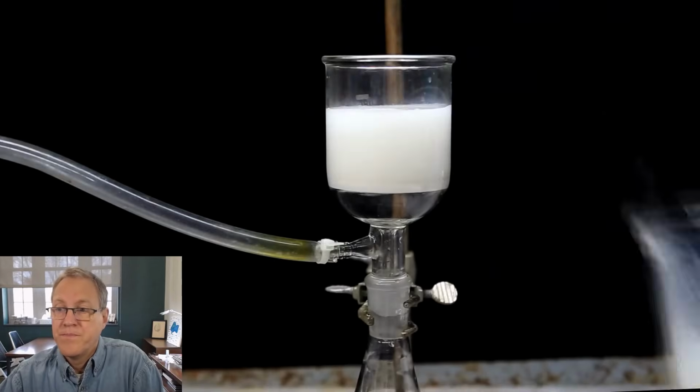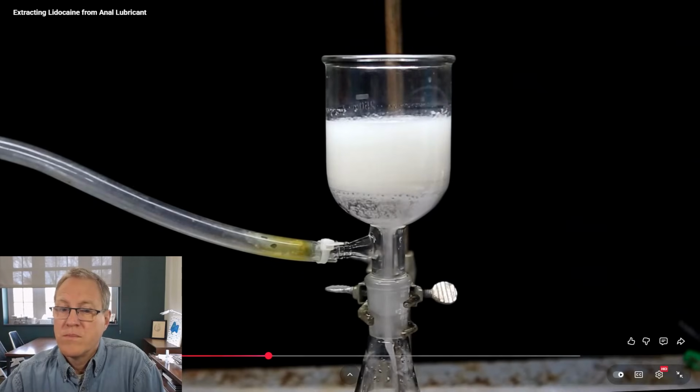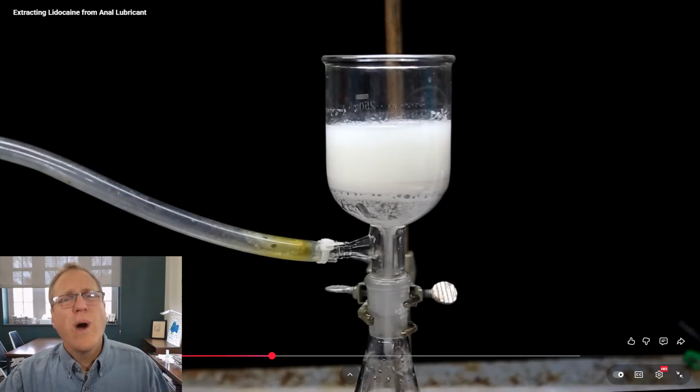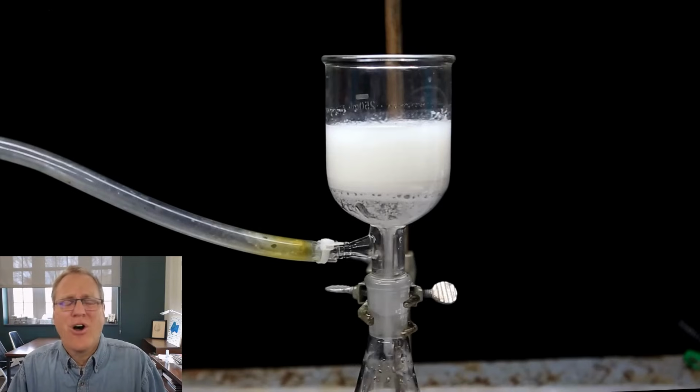And now, the lidocaine can be isolated by vacuum filtration. I would say a vacuum filter is really necessary for this because gravity filtration would just take forever. Why would gravity filtration take forever? Well, remember that this does still have all those thickeners in here. Although it's largely water, there are a lot of these thickening agents, and those thickening agents would kind of gum up filter paper and make the filtration go slowly. So the vacuum filtration helps things go a little more quickly.